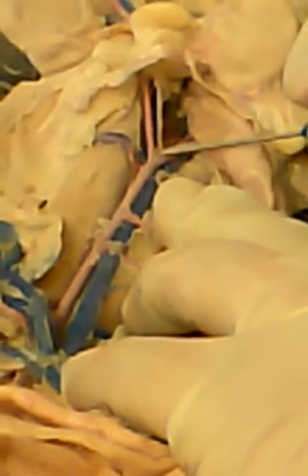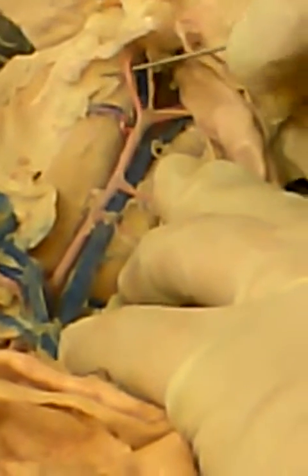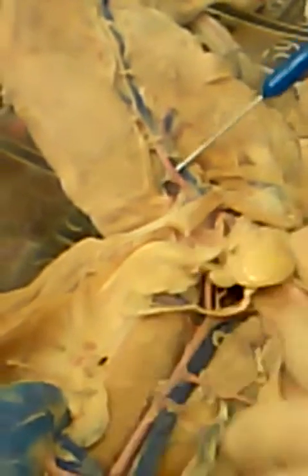Okay. Now, when you get down to the bottom, to the pelvis area here, the abdominal aorta is going to branch into the external iliac artery. So this is going to be the left external iliac artery. And then this artery that goes down into the pelvis, which is the internal iliac artery. So this would be the left internal iliac artery. The external iliac artery is going to go through the body wall. When it comes through on the other side, it becomes the femoral artery.